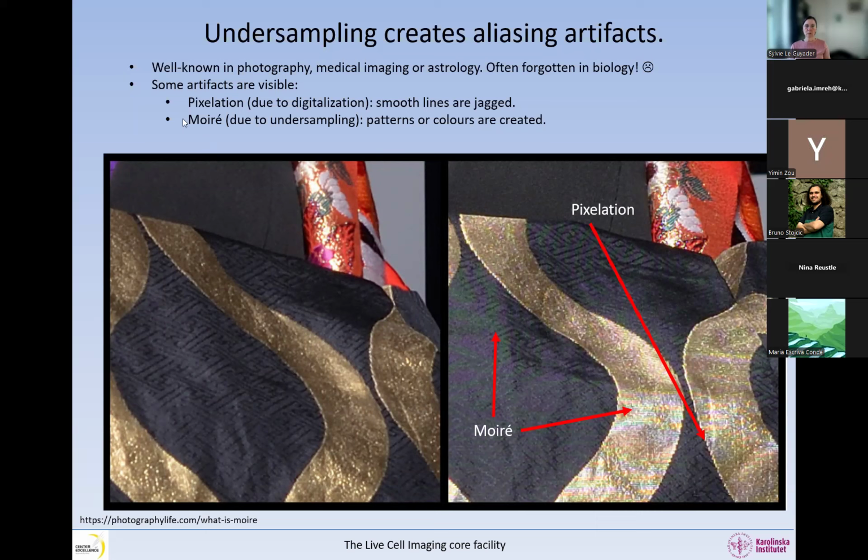Another way we can see the artifacts is moire. For example, you can see here, hopefully you can see on your screen, otherwise you will see it on the PDF, some purple and green, so some colors are a bit different. And here we get a rainbow. These are moire artifacts. This image is undersampled and this one is well sampled, and you do not see this. So clearly the objective has no problem imaging this type of tissue. This is silk, a very fine material with very fine details. But the digitalization creates artifacts. Other artifacts are not visible, but the information in the undersampled image is incorrect. This is only the stuff that you can see, but there are a lot more things that you cannot see.